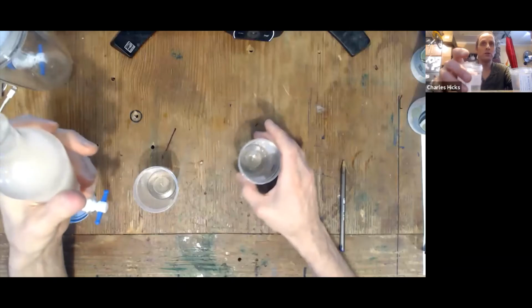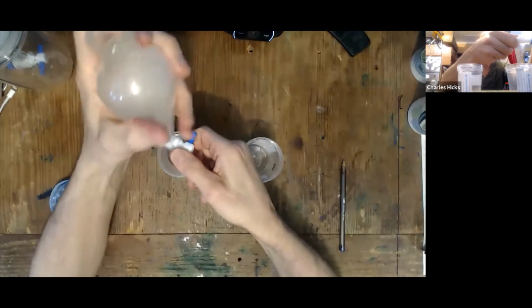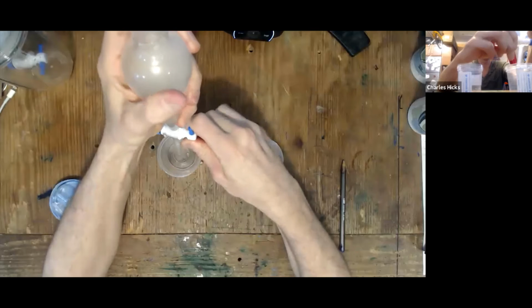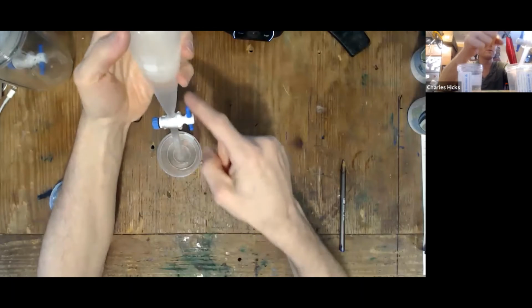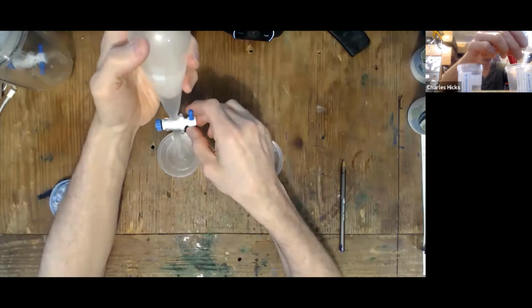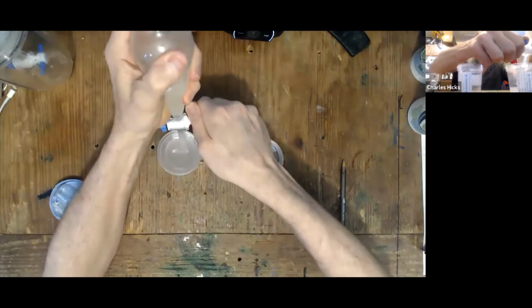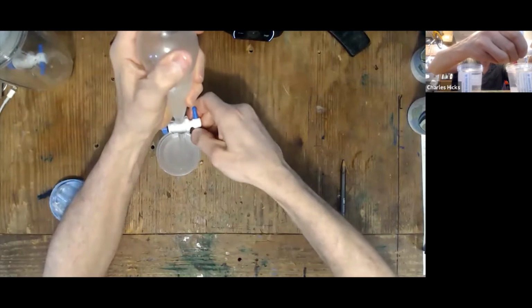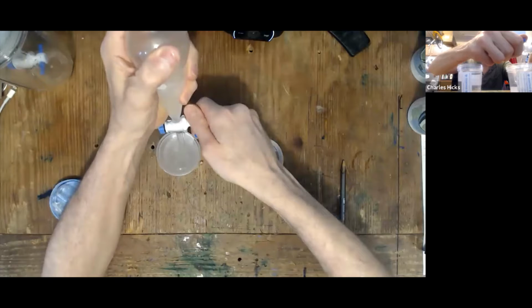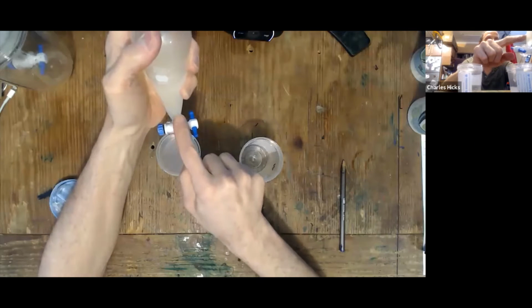Again, we need 2 clean 100 milliliter containers to drain off those layers into. You have to take the stopper off, otherwise air can't get in and the solution won't drain. Start draining the water layer off into the first container. The shape of the separatory funnel comes to a point here so that you can fairly precisely control the volume that goes in there. When it gets down to that point, you want to have your hand on the stopcock to stop it, before you see the next liquid layer coming.